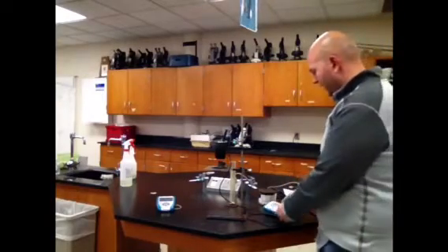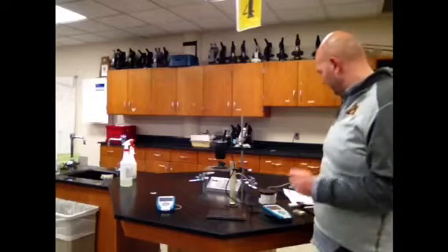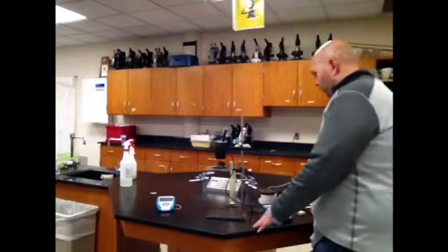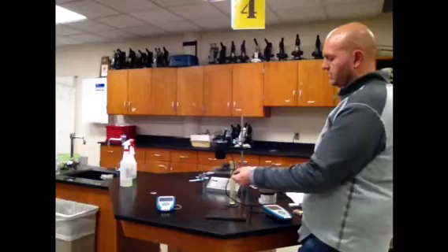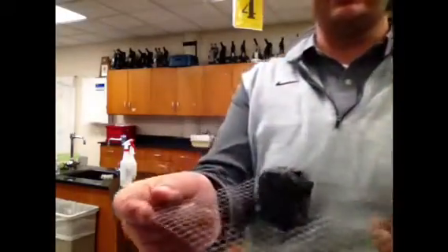Alright, our final temperature, 36.0 degrees Celsius. You should write that down. Final temperature of water, 36.0 degrees Celsius. If you want to make some observations about how much the marshmallow burned, there it is. Look, the whole thing. Yeah. I'm so good at sciencing. Look at that whole marshmallow burn.